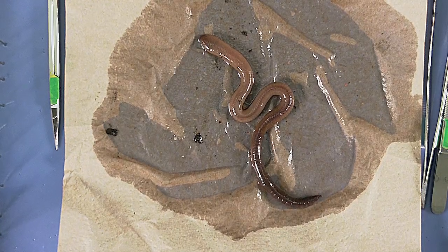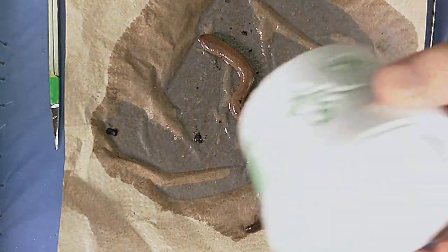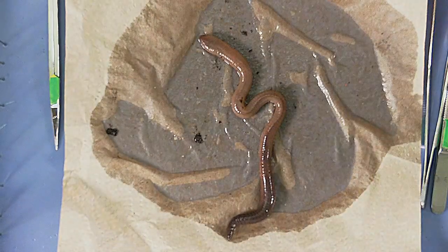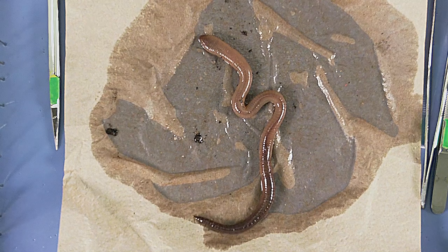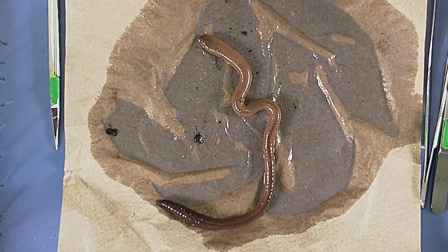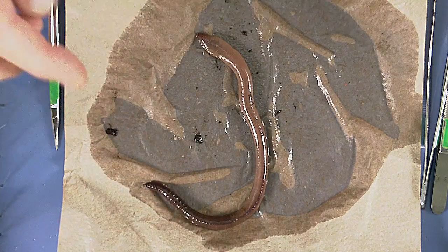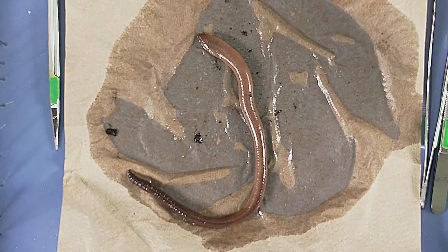We're going to investigate the phylum Annelida by looking at the earthworm — a common earthworm you can buy at the bait store. So the phylum Annelida: these organisms are commonly known as segmented worms. They are triploblastic, meaning they have three body layers. They are coelomates, which means they have a true coelomic cavity, and they have bilateral symmetry. Those are the three body plan characteristics that help define this phylum.